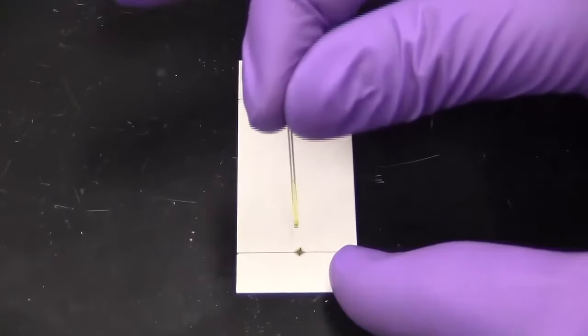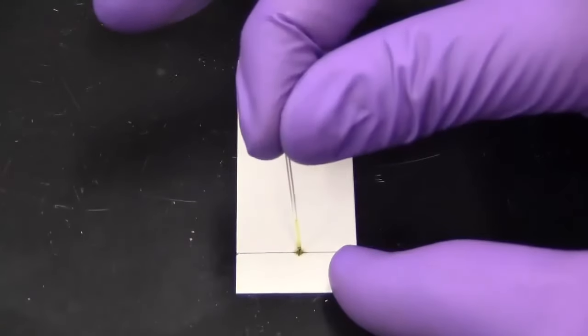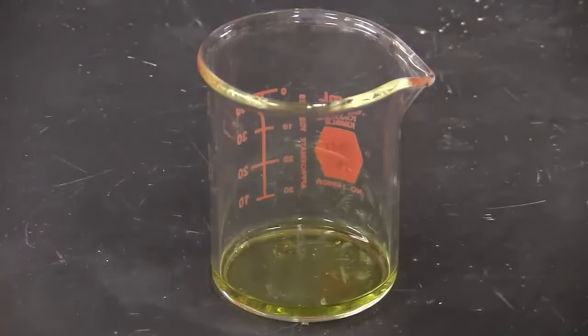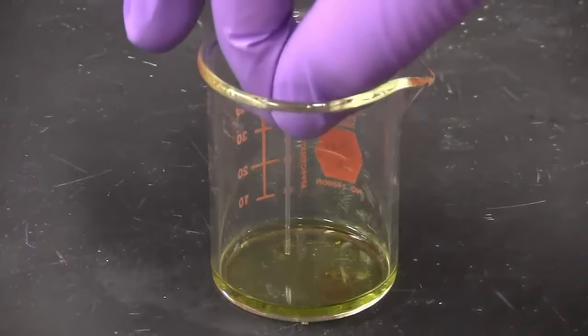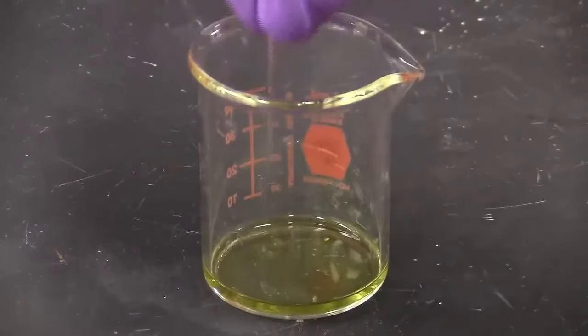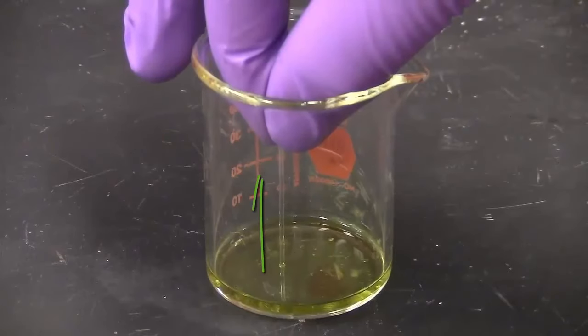Using a microcapillary tube, load the sample onto the TLC plate. To load the sample into the microcapillary tube, simply touch it to the surface of the sample. You will see the sample travel up the inside of the tube due to capillary action.